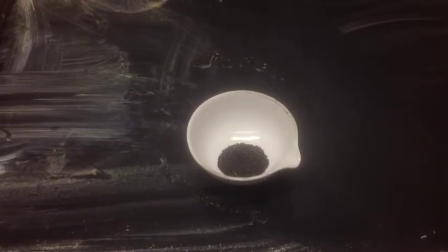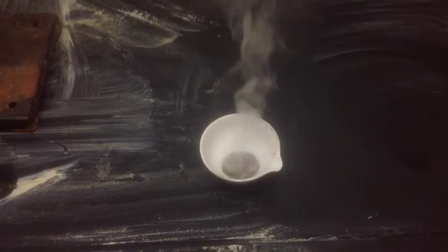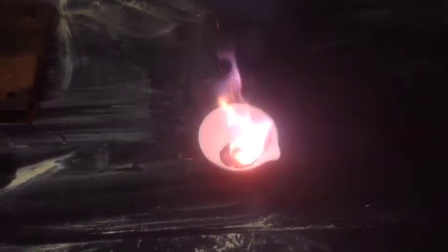We place 5 grams of KMnO4 in an evaporating dish and add 1 milliliter of glycerol. Initially, no visible reaction occurs. After about a minute, white vapor appears. Eventually, the reaction vessel begins to emit a purple flame.